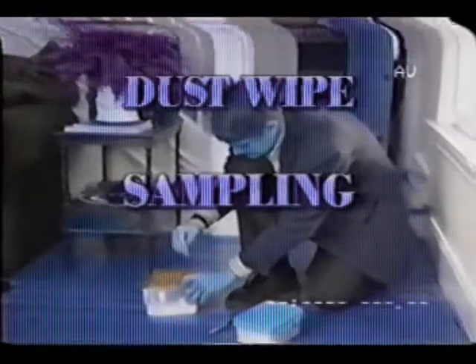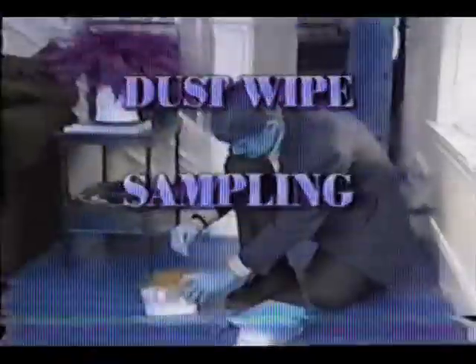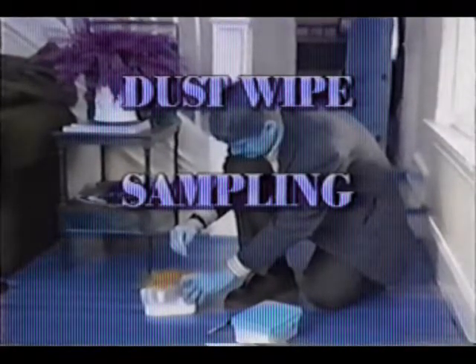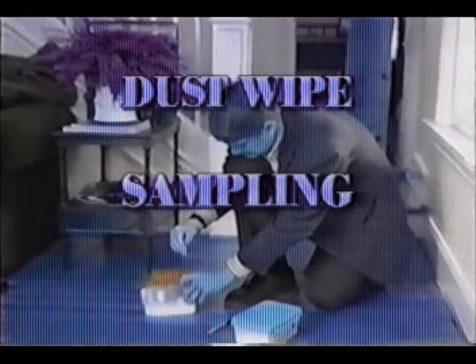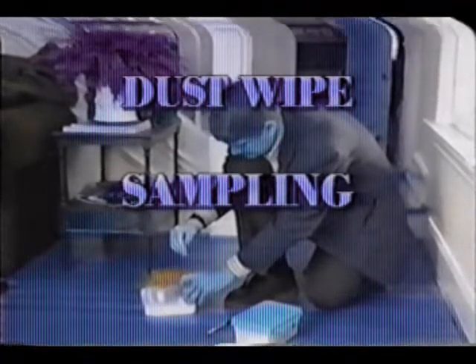Important pathway of exposure to lead. Proper measurement of dust lead levels is therefore essential to the risk assessment process. This videotape demonstrates wipe sampling, the recommended method of dust sampling for most routine risk assessments.